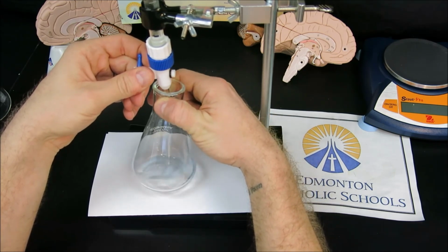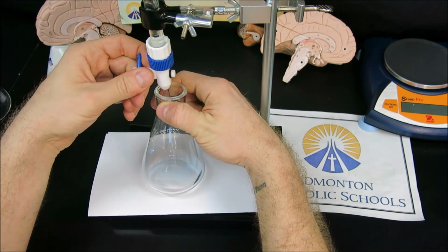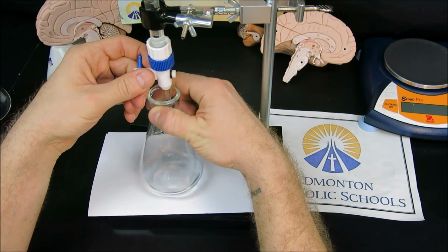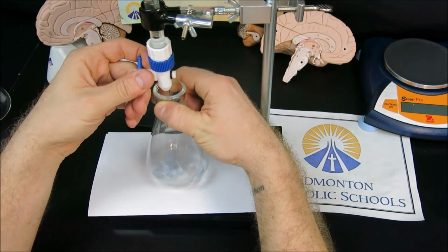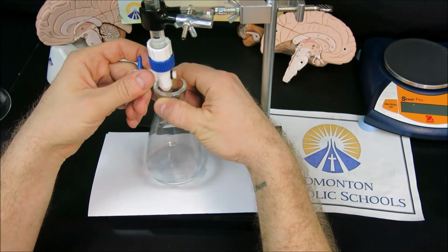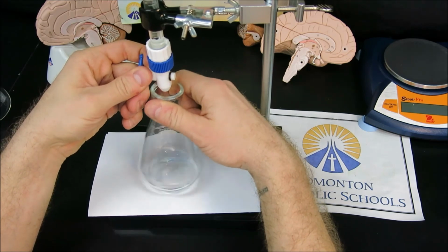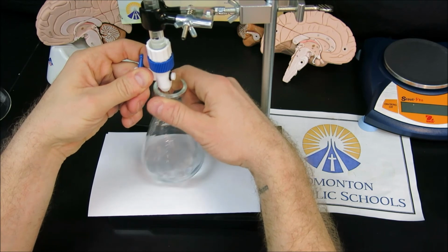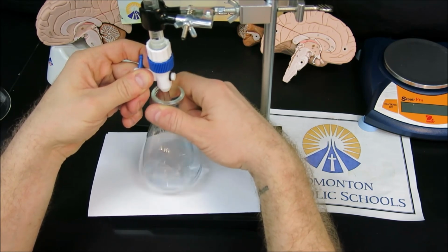What might be difficult to observe in the camera is the color change that occurs when the drop lands. Where the drop lands, it does turn slightly yellow, but the color fades very quickly. This is due to the fact that at this point there's excess sample and a very limited amount of titrant, so we aren't getting our neutralization occurring quite yet, and instead the titrant is immediately reacted and we're left with lots of excess sample still, which is that blue color.